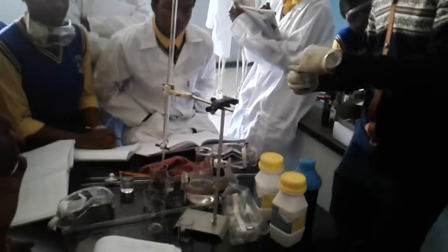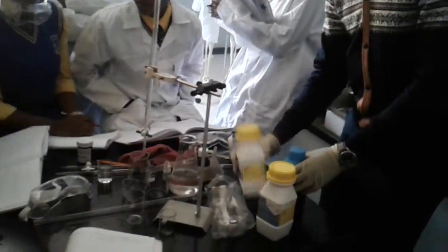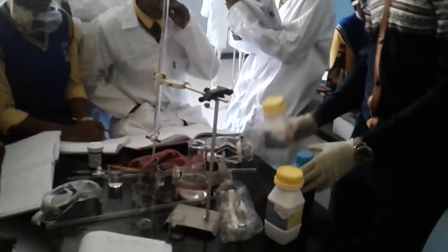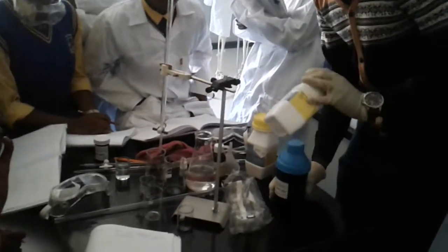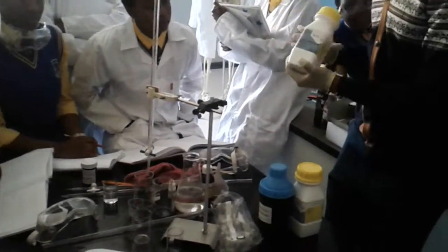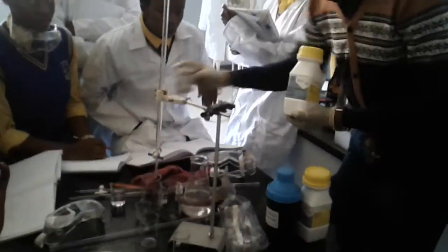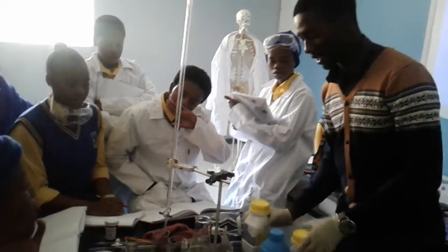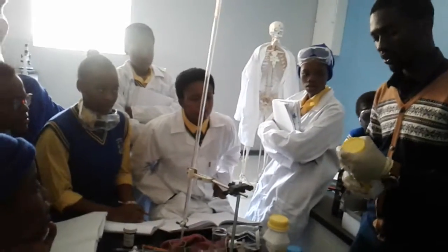Right? It's still oxalic acid. I close it. I put it there. And then where's my sodium carbonate? No, I'm not looking for this one. Guys, why can't I mix a weak base with a weak acid? I keep it there. It will take time for them to react, so I need something strong.